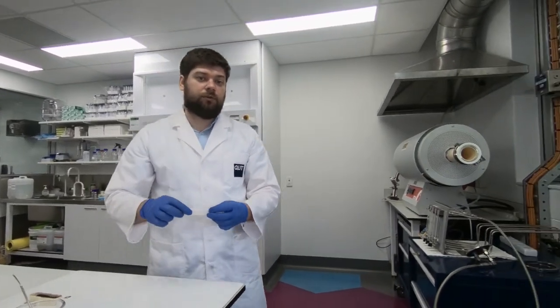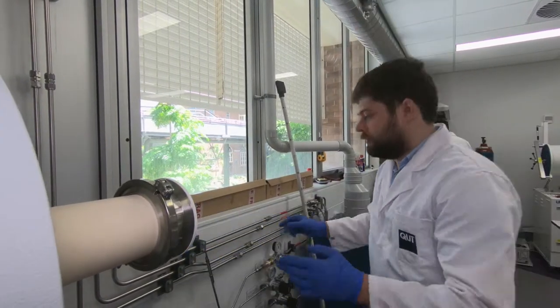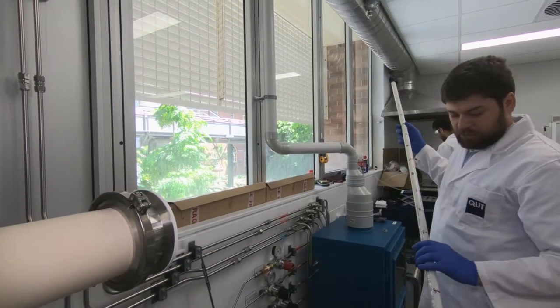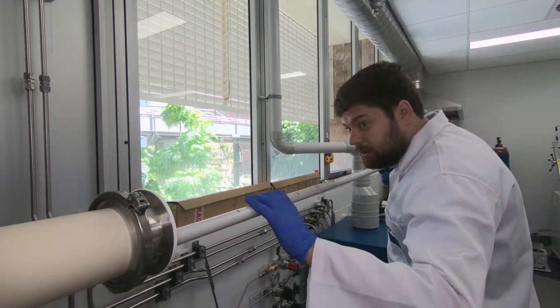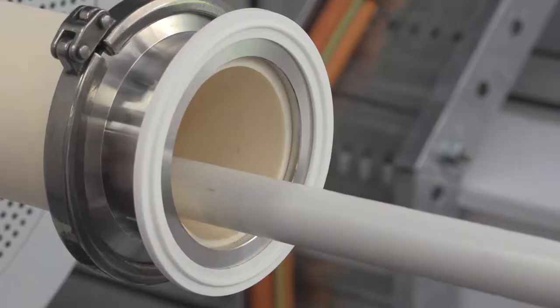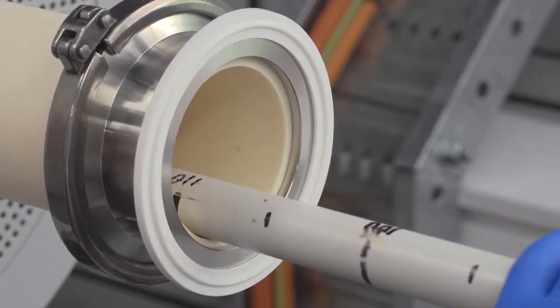So now when our stuff is ready, we can transfer it to the furnace. This bowl needs to be put in the zone with the highest temperature. For this we use this stick with the centimeters mark and put it inside on the length of 75 centimeters. We need to do it carefully to be sure that the bowl does not fall down.